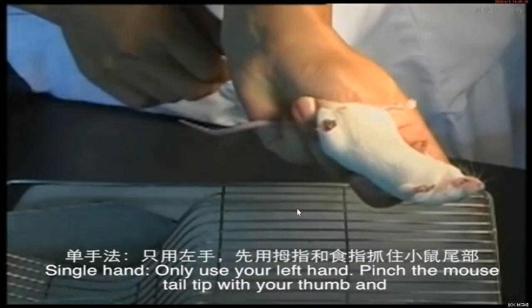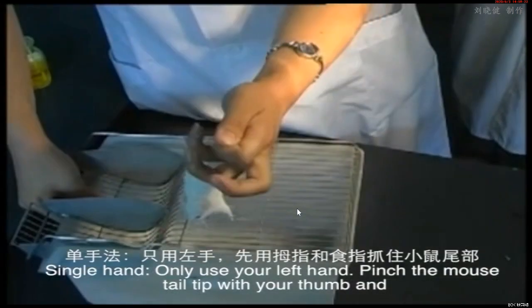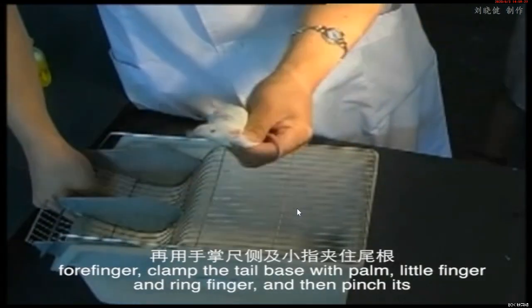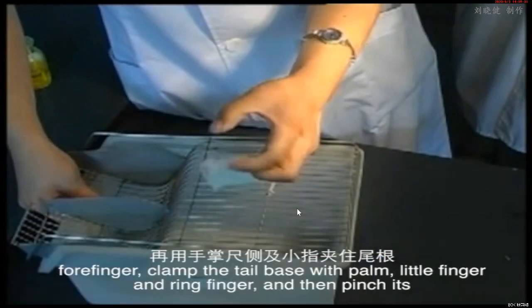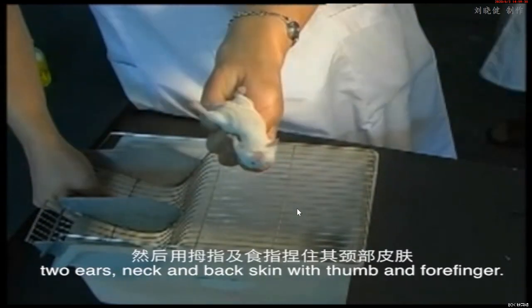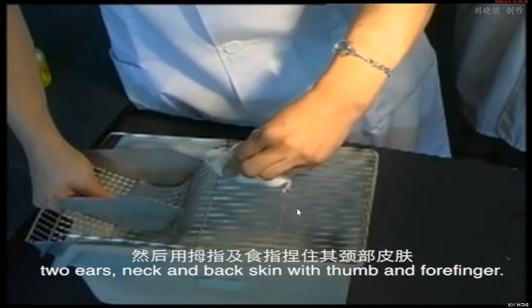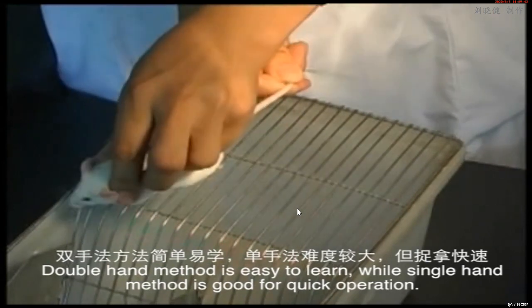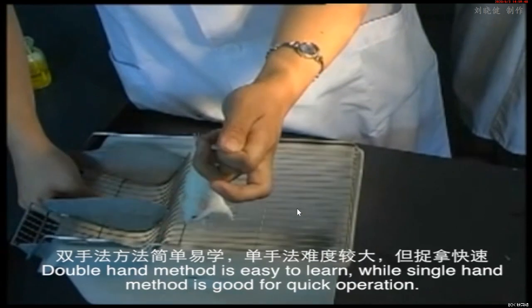Single hand. Only use your left hand. Pinch the mouse tail tip with your thumb and forefinger. Clamp the tail base with palm, little finger, and ring finger, and then pinch its 2 ears, neck, and back skin with thumb and forefinger. Double hand method is easy to learn, while single hand method is good for quick operation.